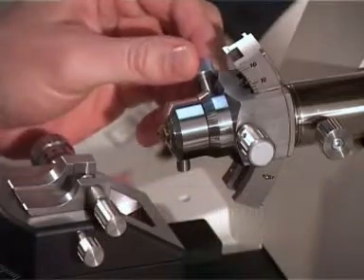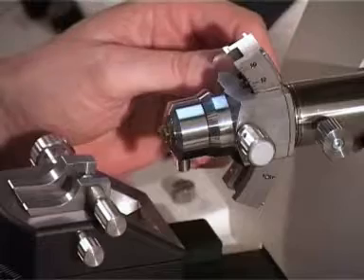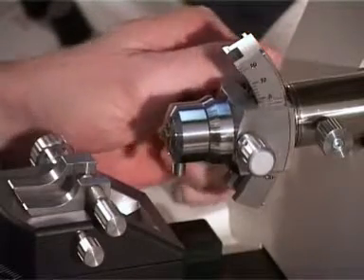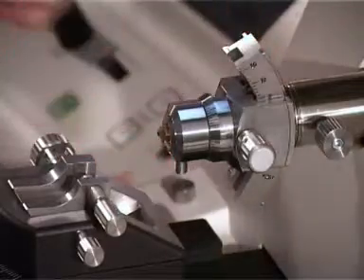The specimen holder with the trimmed specimen is placed and locked into the segment arc. By adjusting the segment arc, the specimen is moved precisely to the zero position.